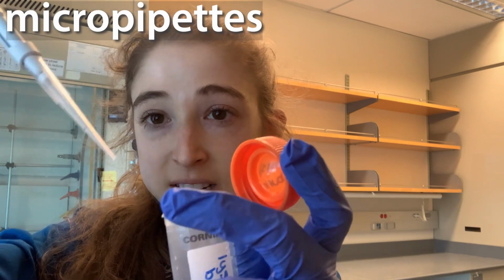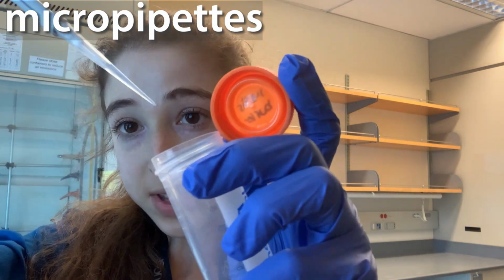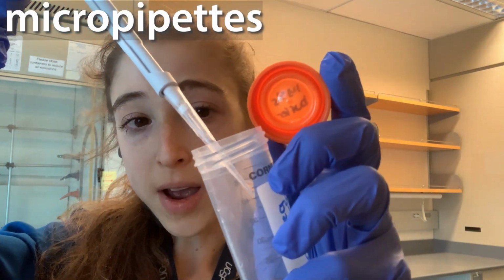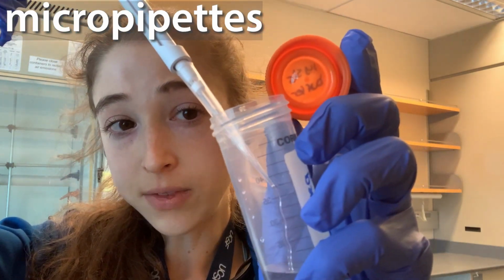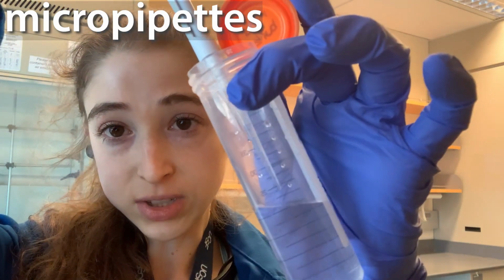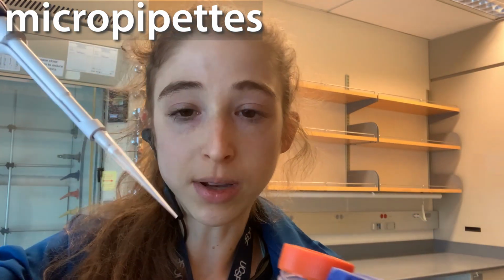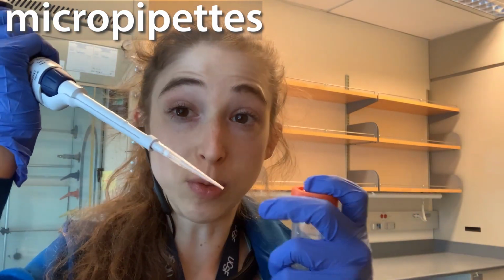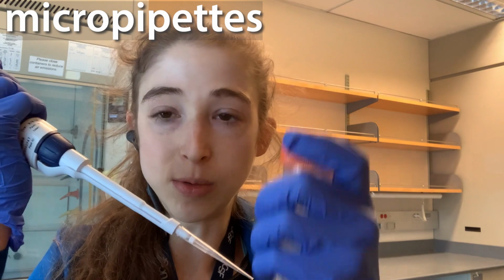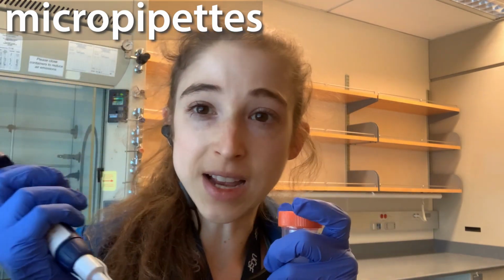Speaking of bubbles, you would not want to do what I just did, where I just go like that. See, now you get splashback. You want to go slow and steady, both in and out. When you go out, you want to go onto the wall of the container, or into the surface of the liquid you're pipetting. Use the surface tension coming from the interactions between the liquid in your pipette and the liquid in here, or the surface of the tube, to help draw things out.